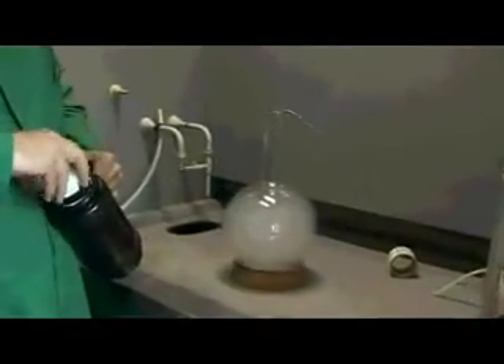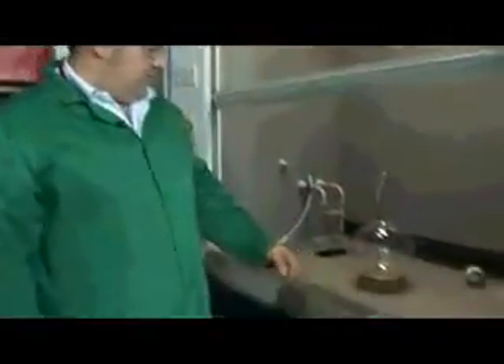I've just filled up my vessel with some oxygen. This is liquid oxygen, which we made for an earlier demonstration, and we've used it to drive off all of the non-combustible nitrogen from inside this glass vessel. Look at all that oxygen floating around the bottom of that flask — it's really cool, all oscillating. It's a really nice experiment.